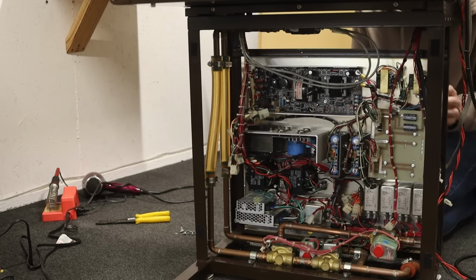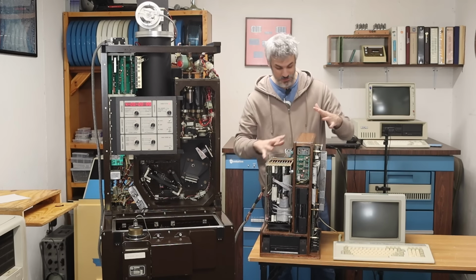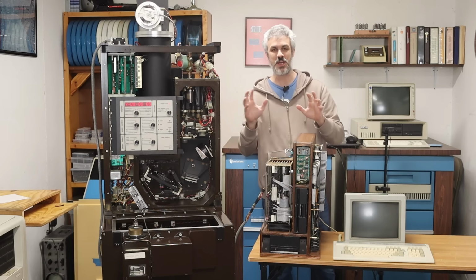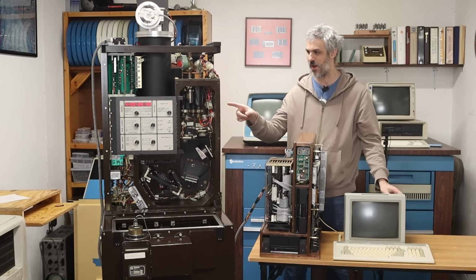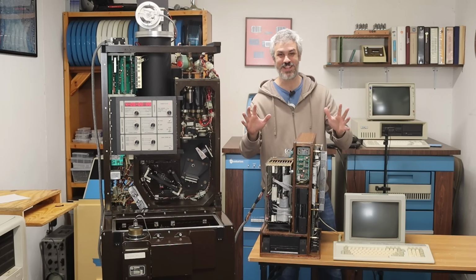Okay, spectrometer's on and powered up. Isolated power supply seems to be doing just fine. Looks like we're in mode 4. It hasn't power cycled once, and everything's plugged in, just nothing's on at the moment. Let's turn the CRT on, because in my testing, that seemed to be when things got the most crazy. Whenever I kicked the CRT on, this thing would power cycle. That's a good start. It didn't power cycle.